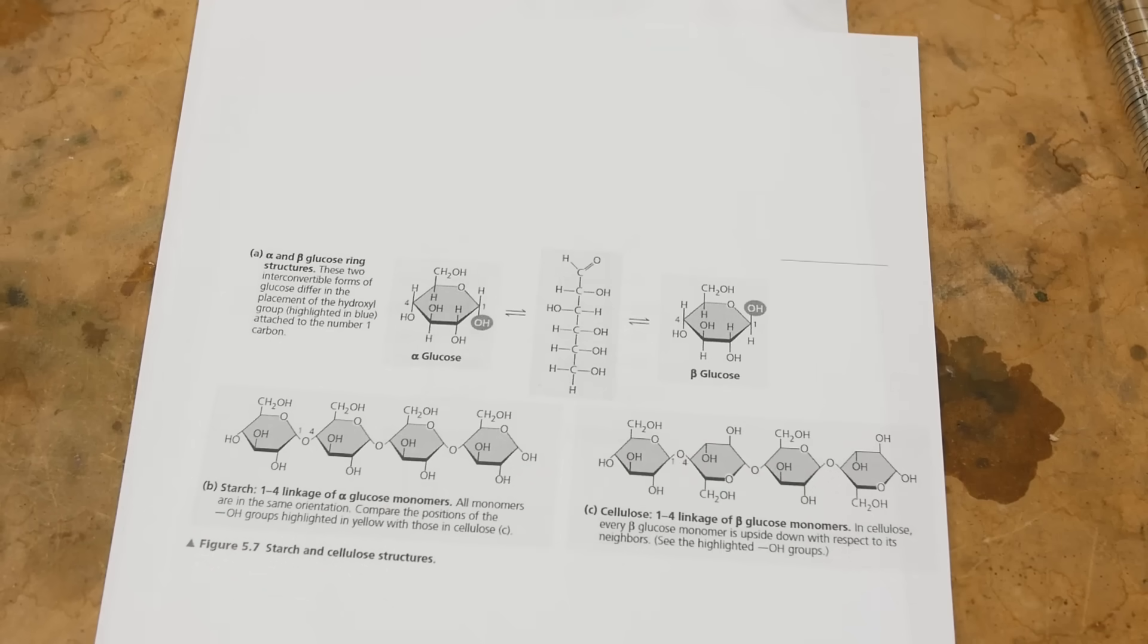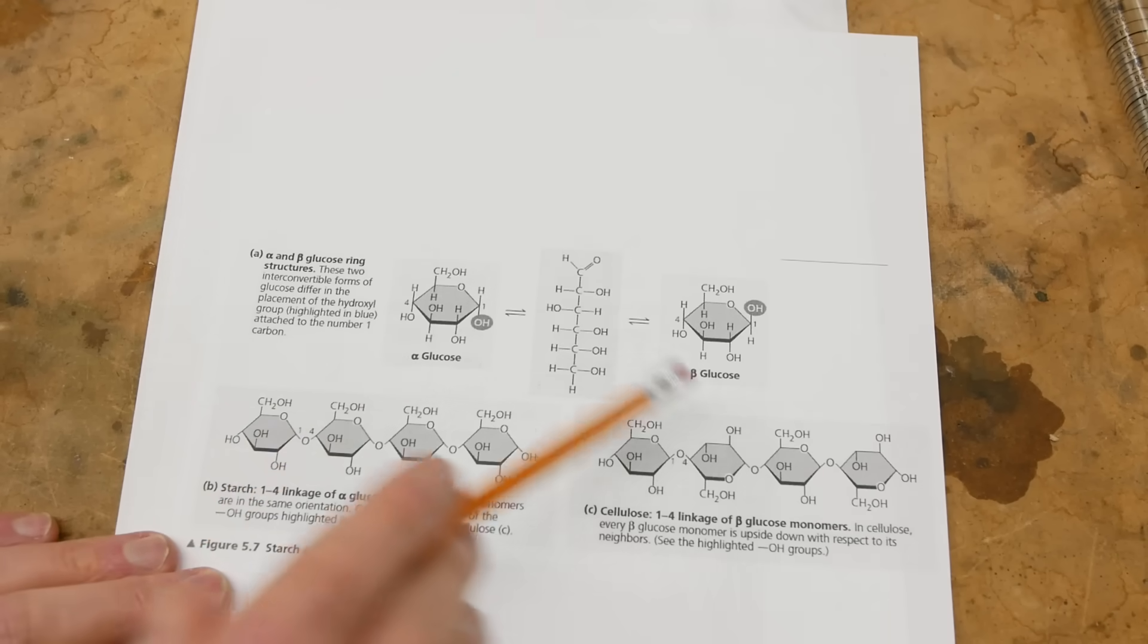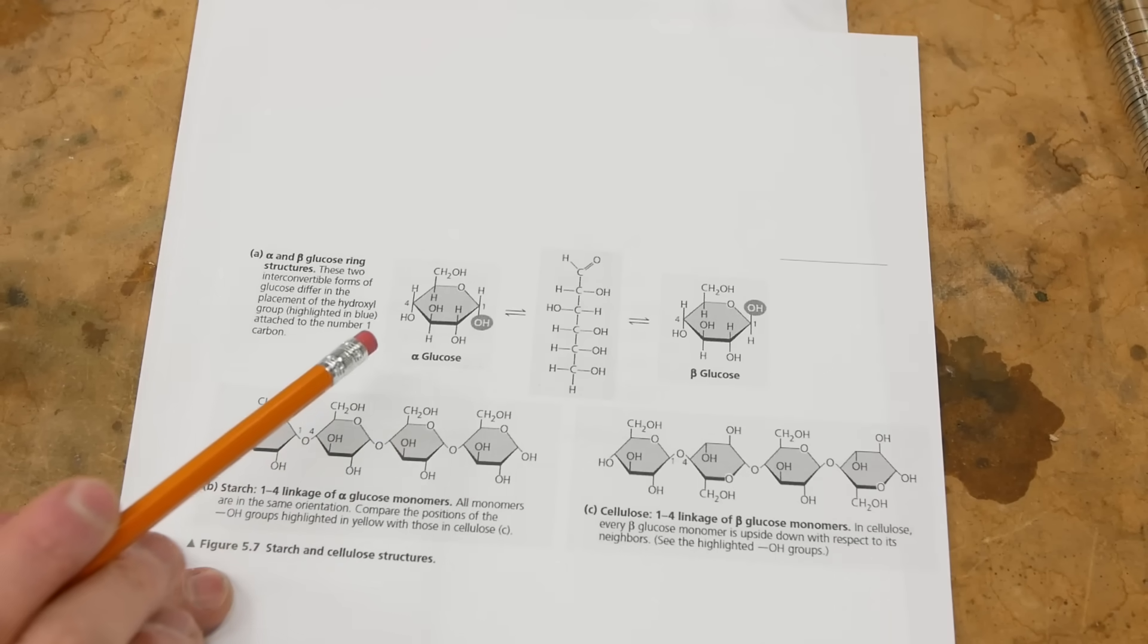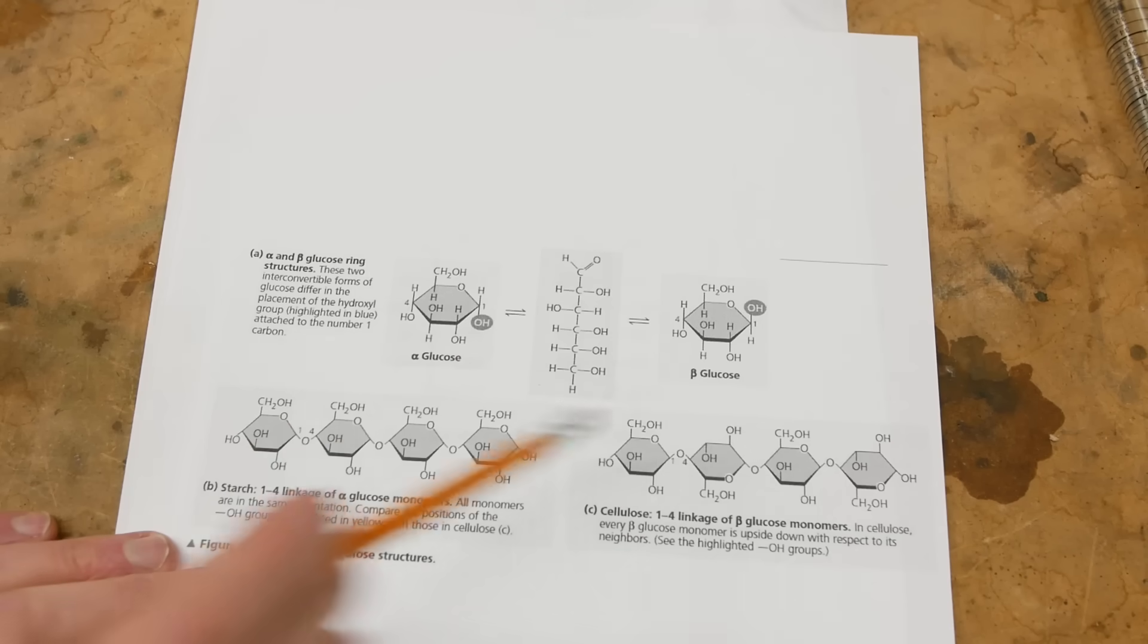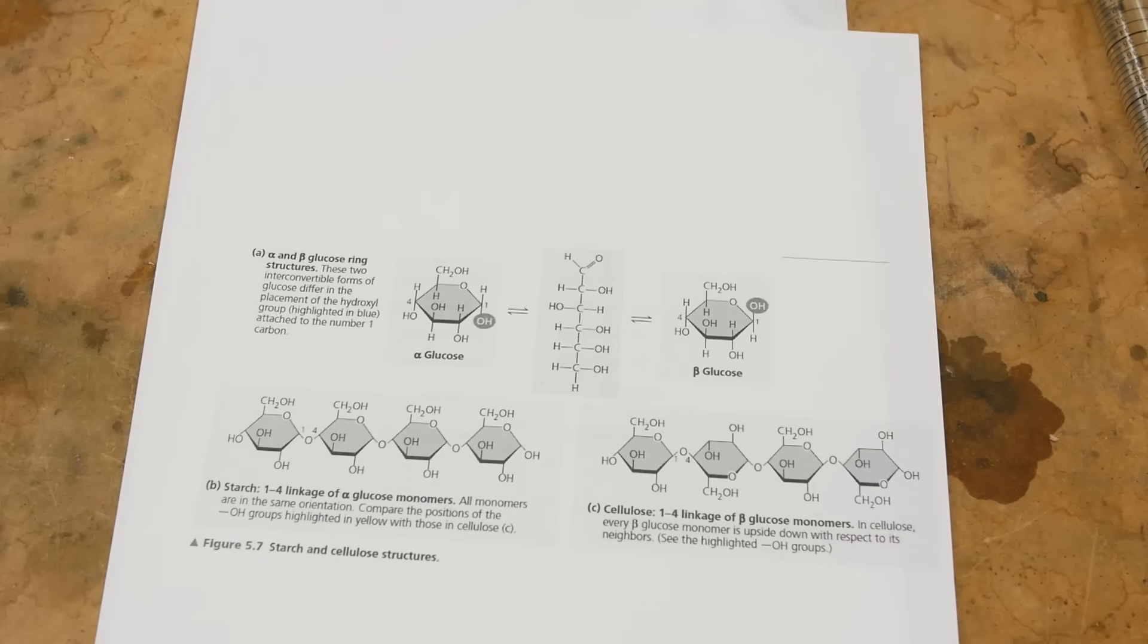Now, as it happens with glucose, these taste exactly the same. So you can't really perceptually taste the difference so that you can see it in the polarimeter very easily.